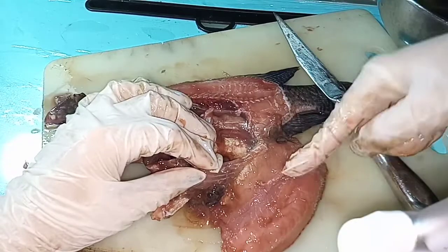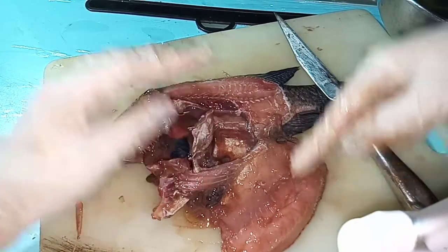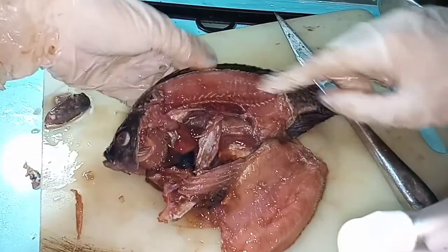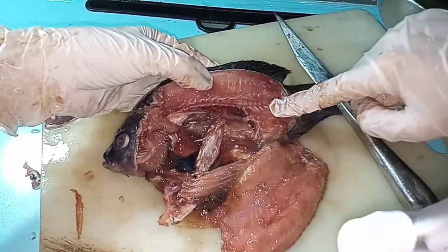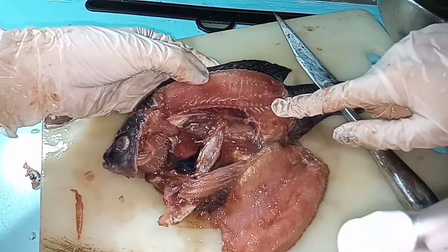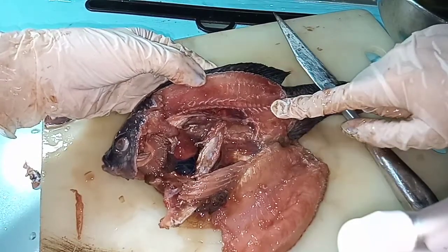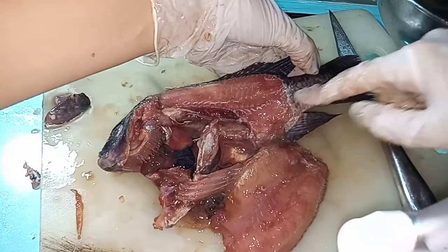This is the muscle of the fish. Now, for the bone, we could see the spinal cord and the spine. Here is the lateral line.